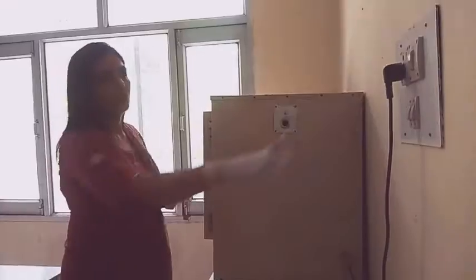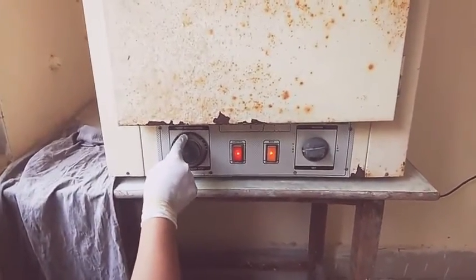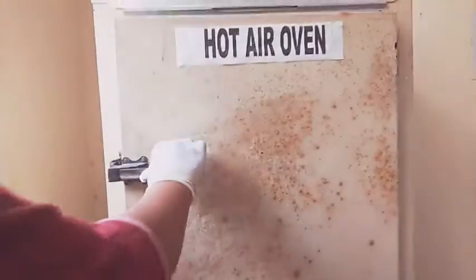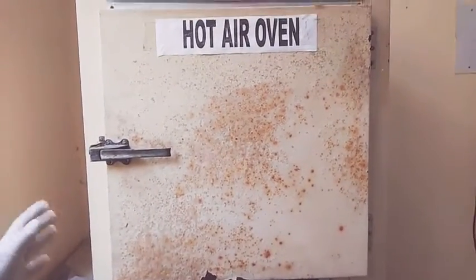Now we have to keep it in the hot air oven at a temperature of 100 to 105 degrees Celsius. Switch on the hot air oven and set the temperature at 105 degrees Celsius — it is showing 105 degree temperature. Now keep it in the hot air oven for 1 hour. Close the door and after 1 hour we will note the reading.